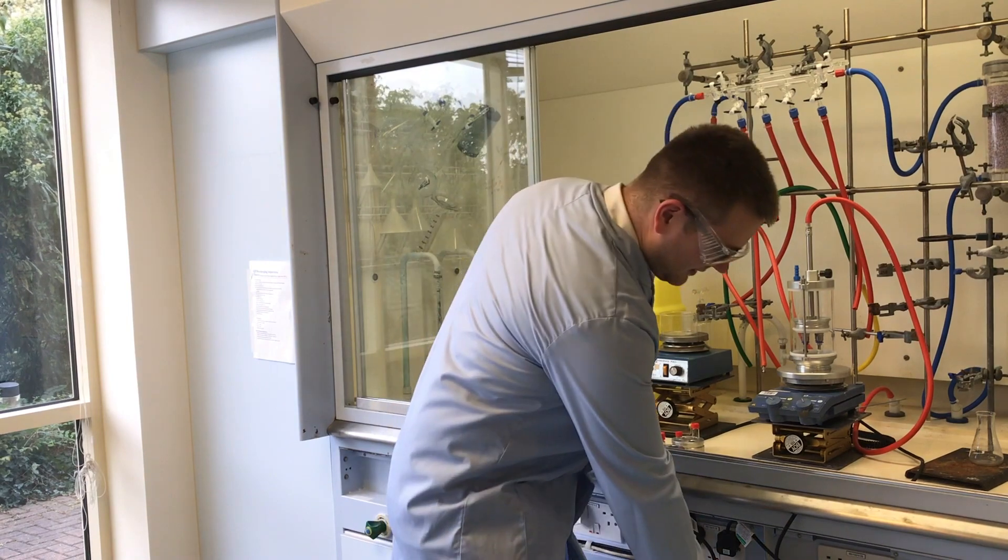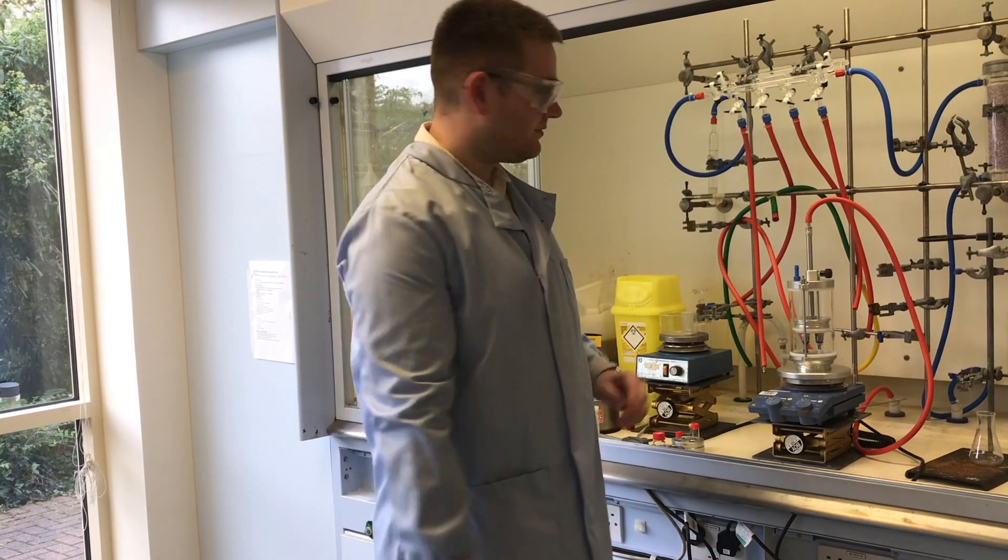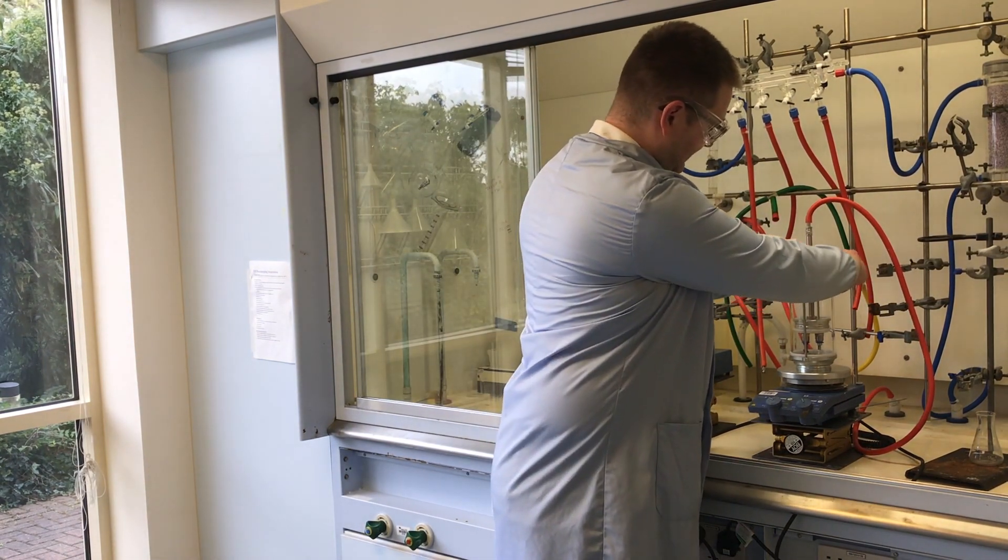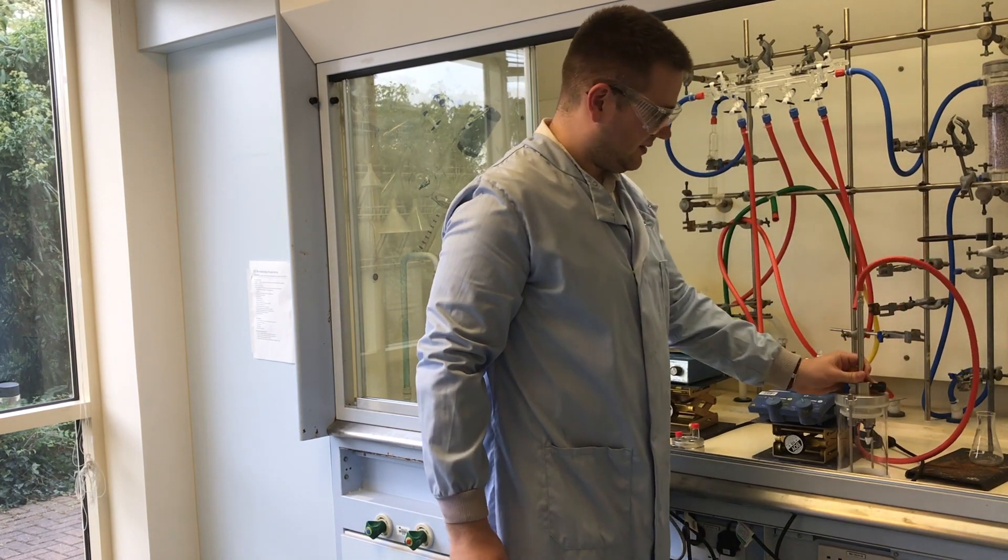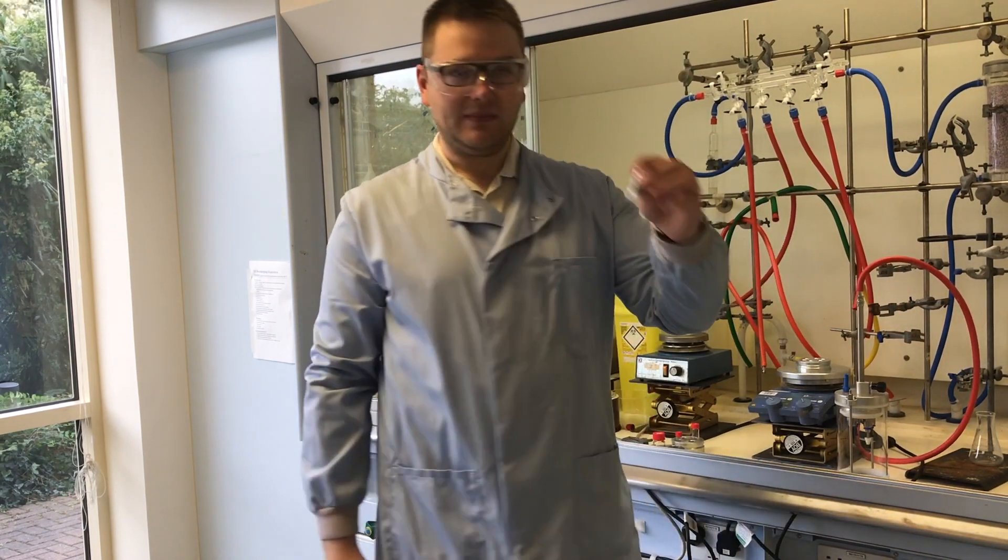When you're finished, just turn the vacuum off, lift up the plug, and your sample is dry.